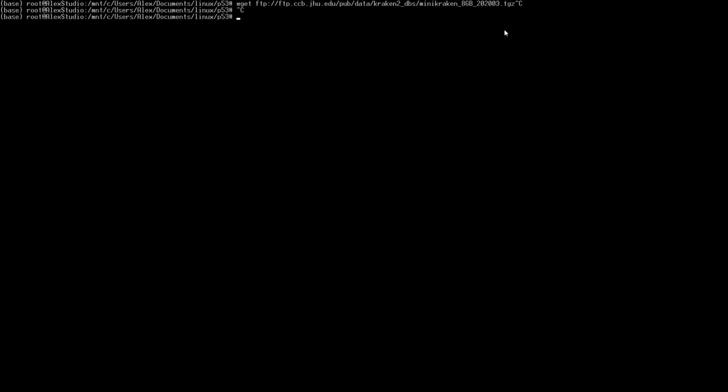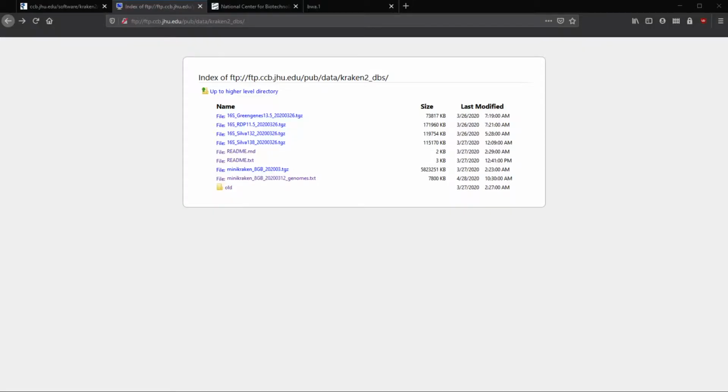What we should do also, since we want to look at whether or not there was human contamination, since we're looking at mice, is download that text file. Go back to Firefox. We want to download this text file here. And that has the list of genomes that are included in this database file, which we can search through to find out whether or not mouse is in there. So we don't want our reads to be mapping to mice when looking for contamination. That'll give us a false flag, but we want to make sure that human is in there. So it goes both ways. So we have both of those downloading.